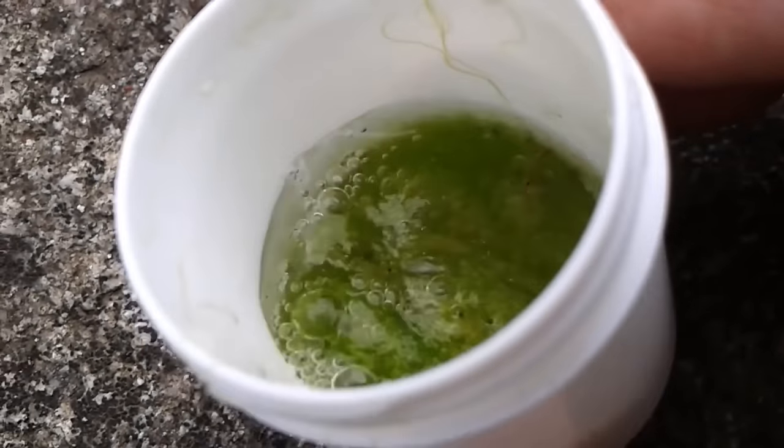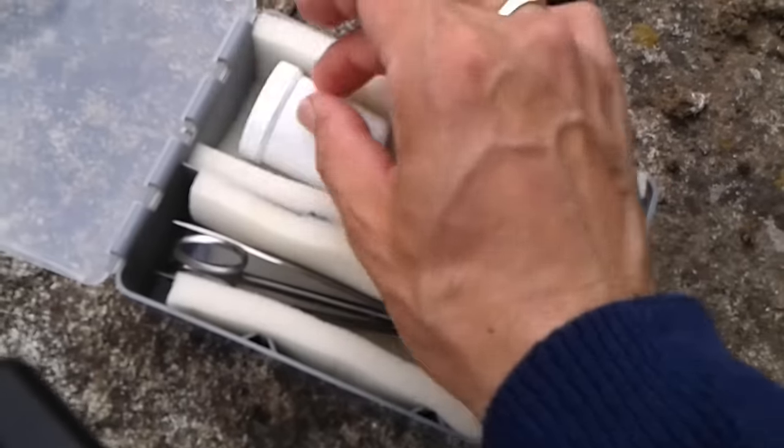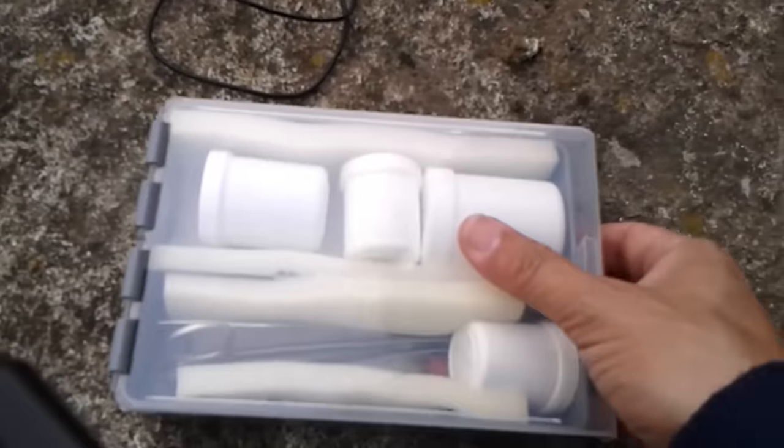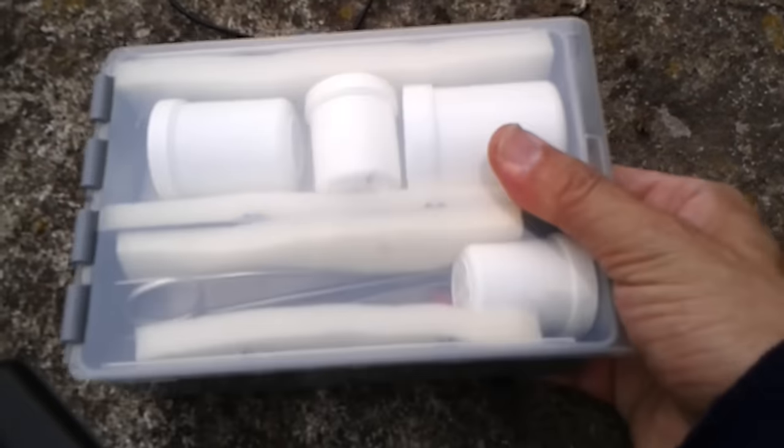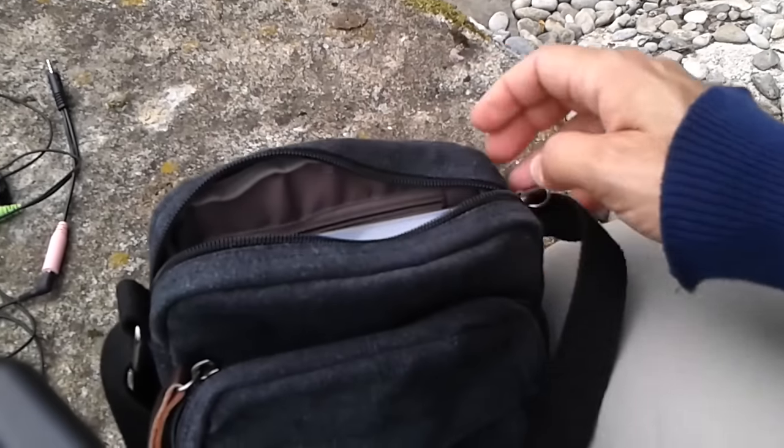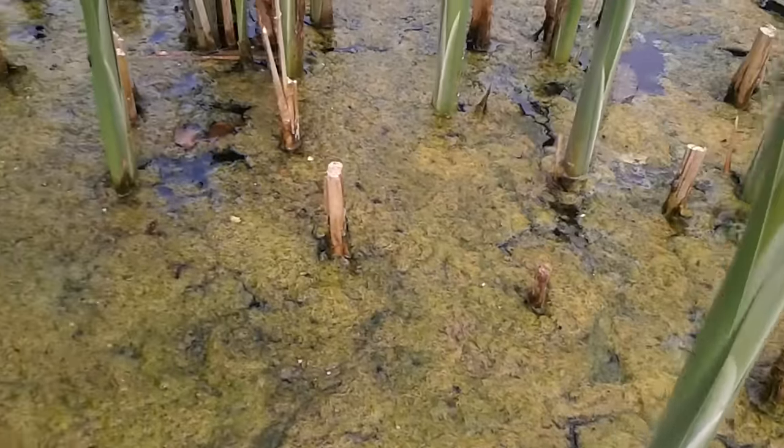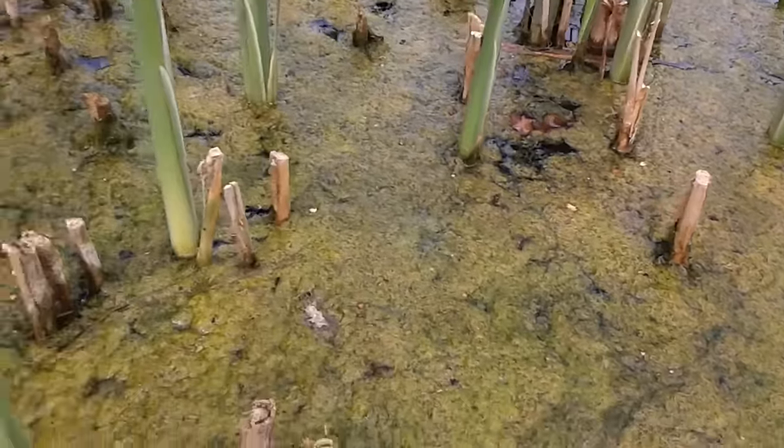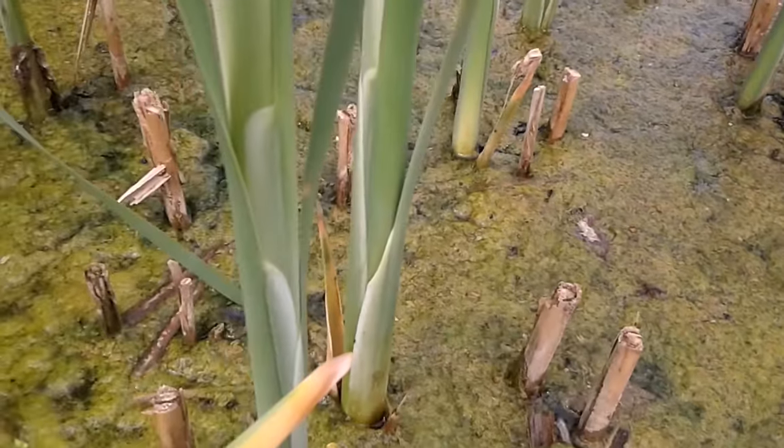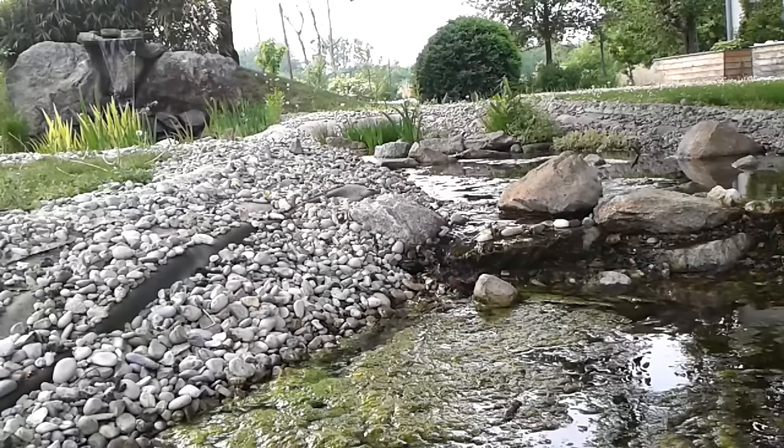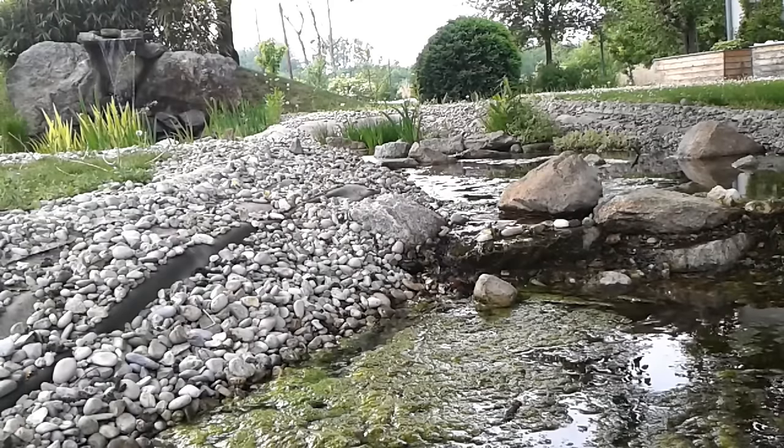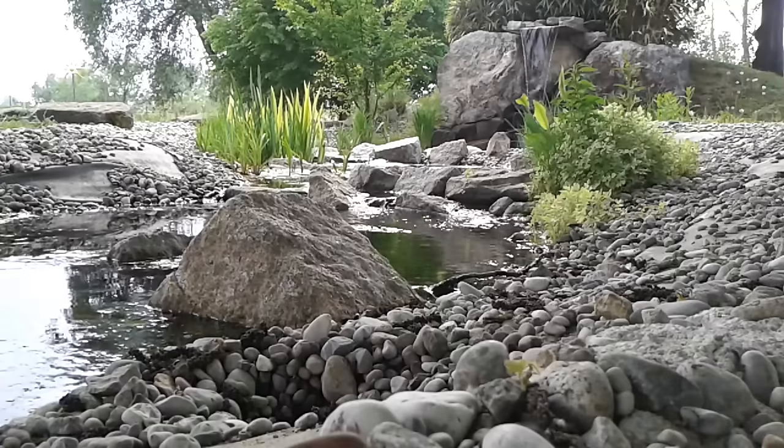That's basically my field box. It's a little box used for tools, nails, and screws. I bought it in a hardware shop. As you can see, plenty of filamentous algae, interesting to observe under the microscope, but a little bit over-fertilized maybe.